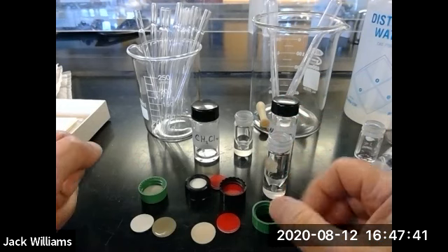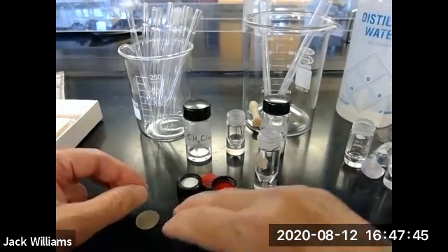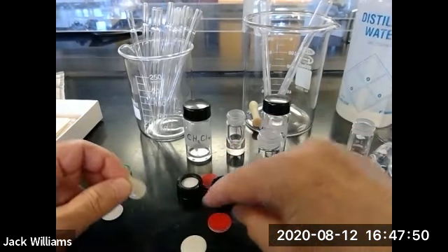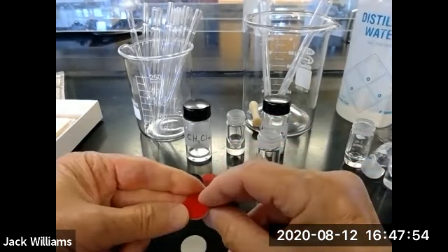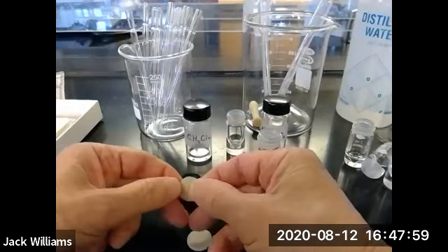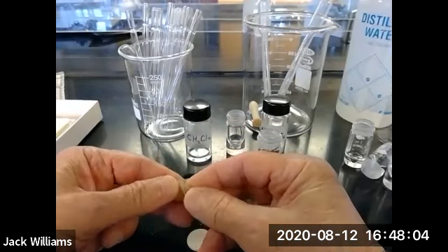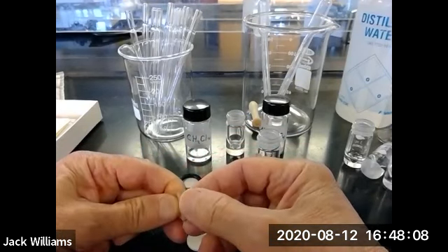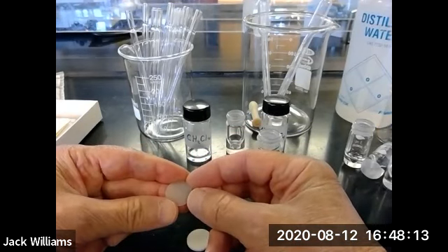Now we're going to have to cap this. So grab a cap, grab a liner. Now, if you look at the liners, some of them have colors, some of them don't, right? So here's one and it's red on one side. Oh, it's red on the other side. So this one's got red on both sides. This one over here has got a shiny side and a dull side. Now, it turns out that for the liners that are used, there is a side to this that is coated with Teflon, and that's because Teflon is a very unreactive material.